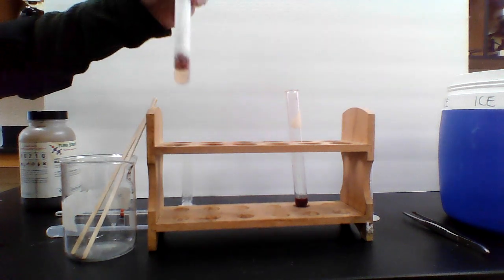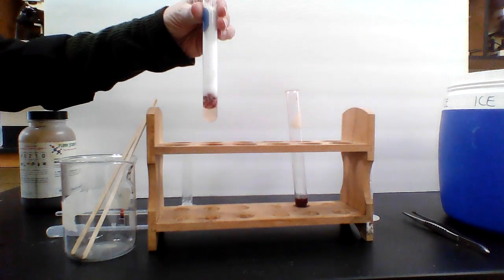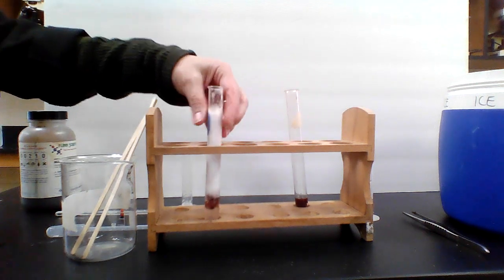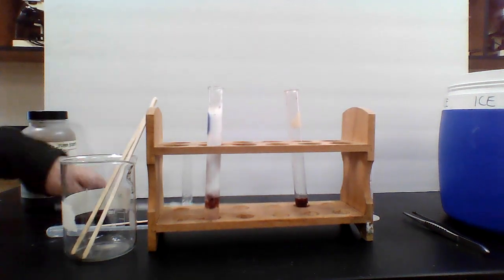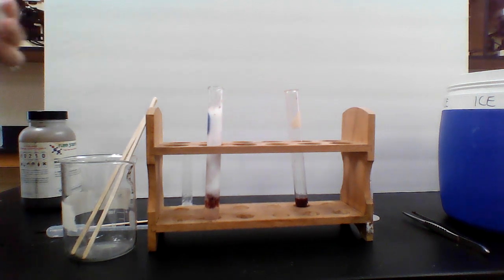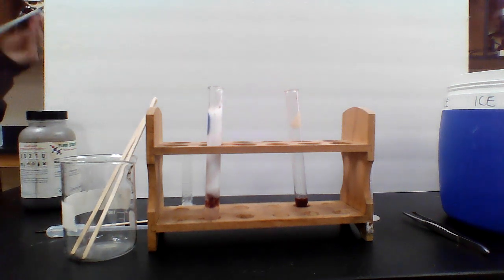Let me try spinning it just a little bit more. Nope. I'm going to say that's a negative splint test. That's a little bit of a surprise result. So a negative splint test for that one. So the temperature, I think we said, went up to 29. We gave it a 9 for bubbles. And the splint test was actually a no, which I think is quite surprising.